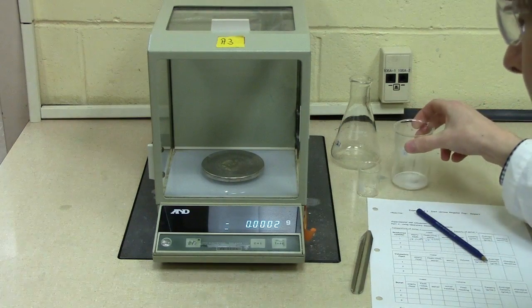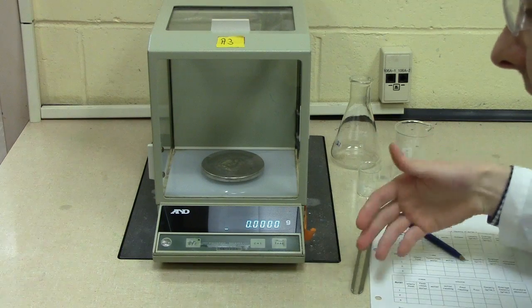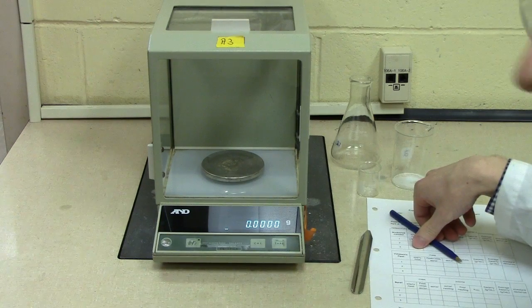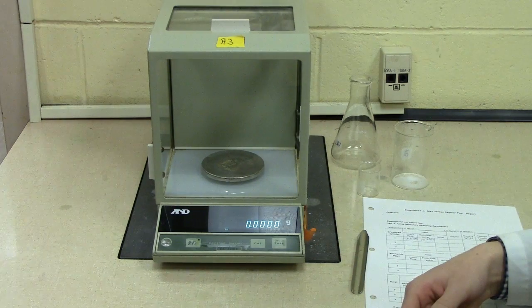When doing this, although you're looking for roughly one gram in this case, it's not important that it is exactly one gram. It's just important that you determine a measurement that is precise and measured at four decimal places.